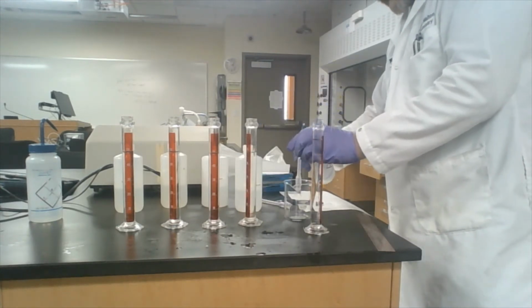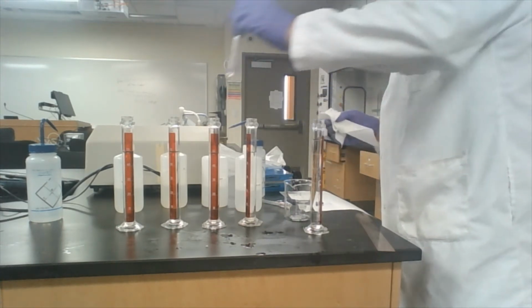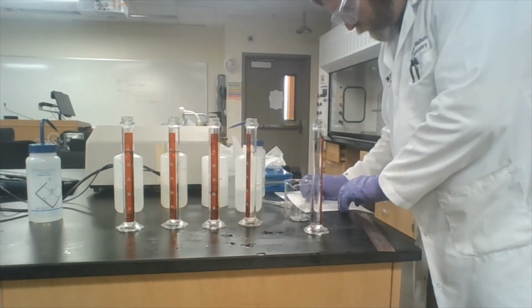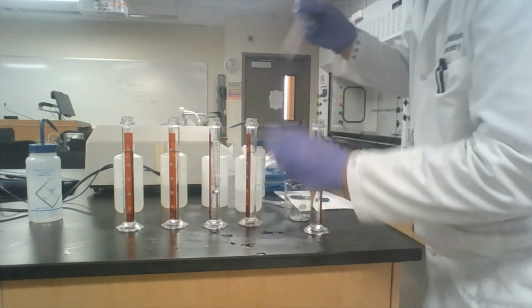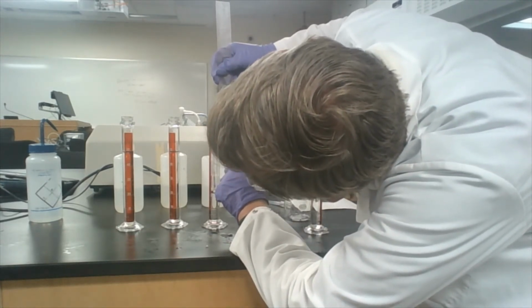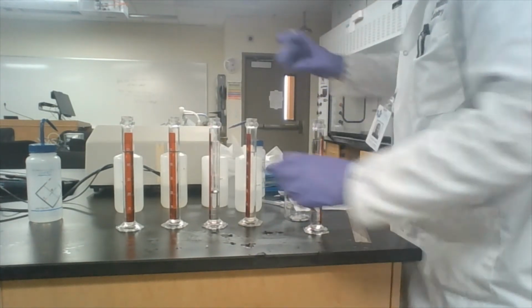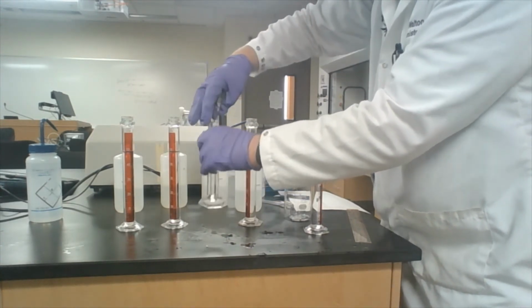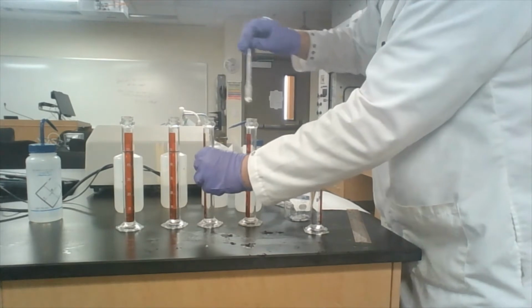And we want to rinse it, just to be sure, blot it. And then we're going to put it into the 8%. And then again, we're going to measure from the water line to the top of the pipette. And that is 31. These fat fingers don't go in there very well. I have to get some forceps.